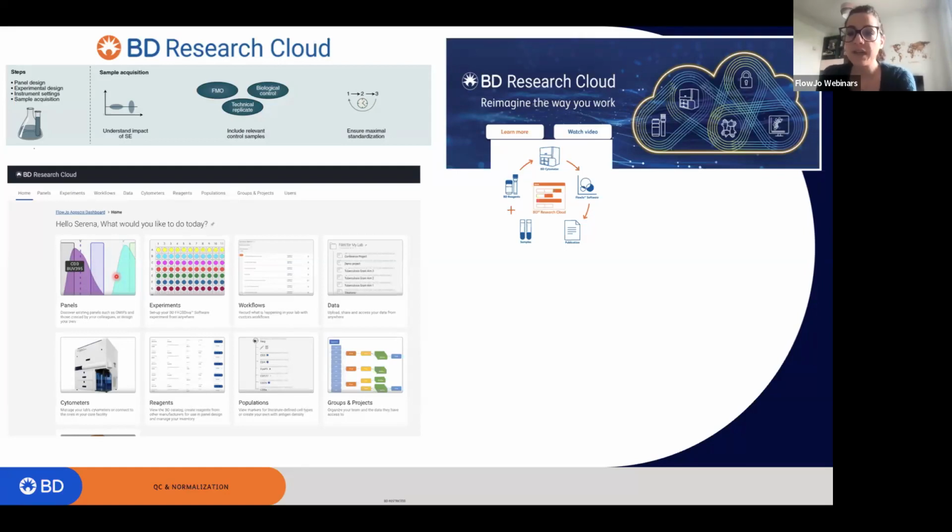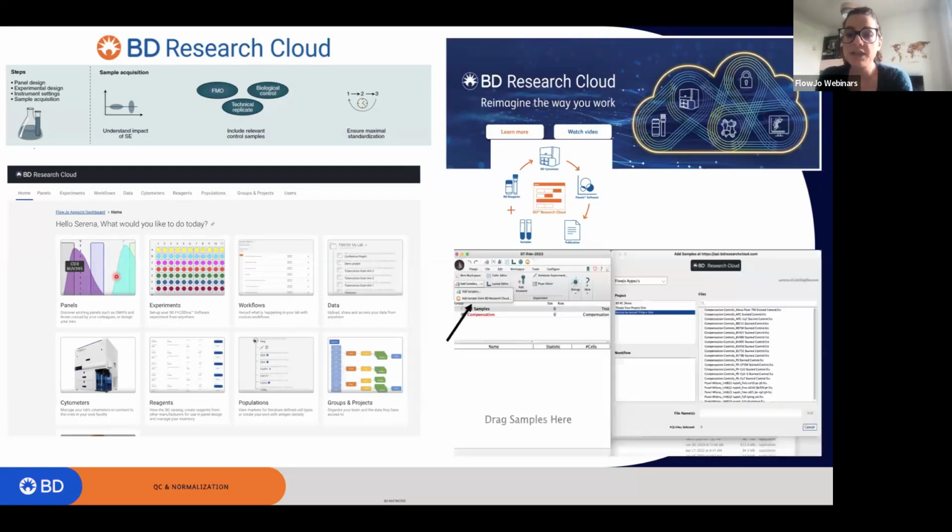Once you have taken advantage of all these tools, you can always store your data within BD Research Cloud, and there is a direct connection with FlowJo. So you can basically add your samples directly from BD Research Cloud. If you ever opened up FlowJo, you may have noticed that on top right here, there is a BD icon. This drives you directly to the BD Research Cloud tab. So you can log in right away, or you can create a free portal account. Or if you go on Add Samples, you will find these Add Samples from BD Research Cloud right here.